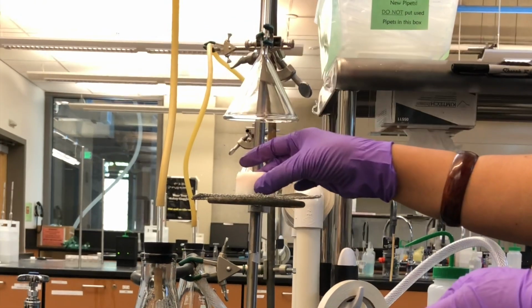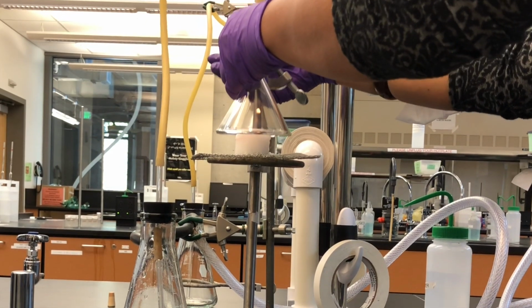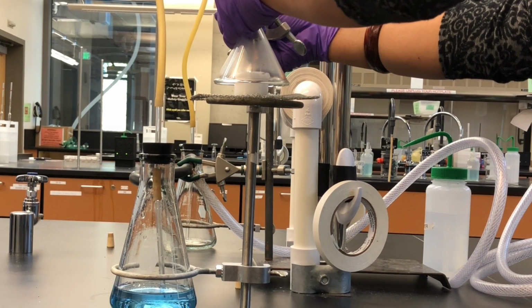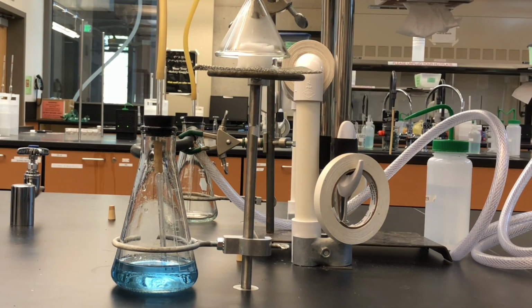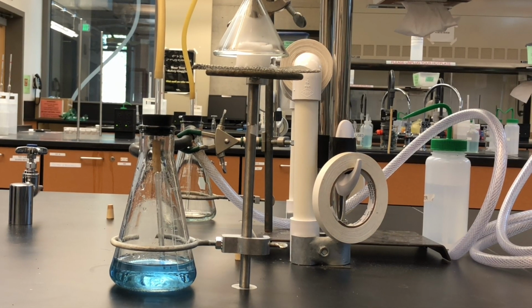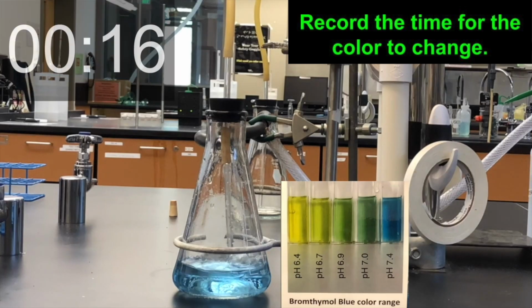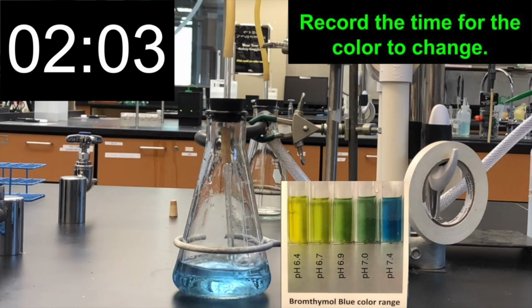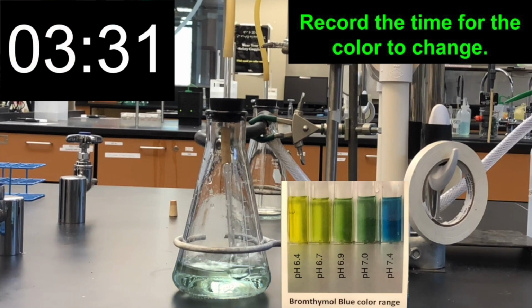Place a lighted candle under the inverted funnel. The smoke-filled air produced by the burning candle will be sucked in through the inverted funnel into the vacuum flask. The carbon dioxide released from the combustion process will react with the water. Turn on the vacuum aspirator. Observe the reaction and record the time needed to turn the color of the solution from blue to yellow.